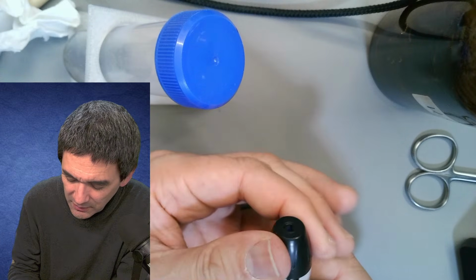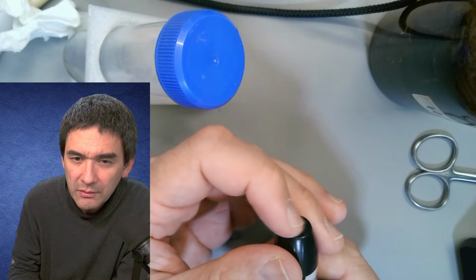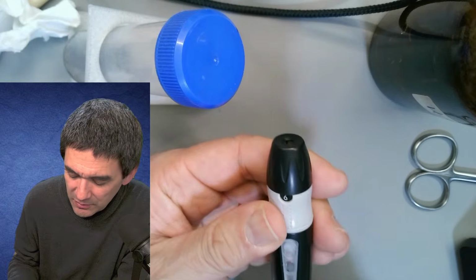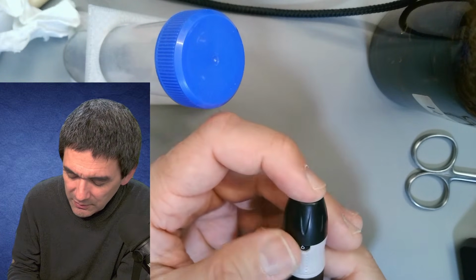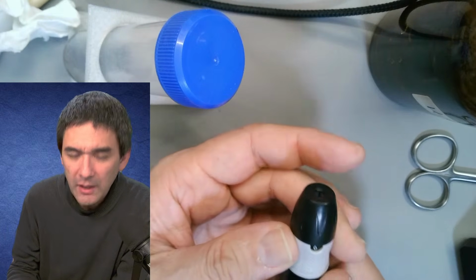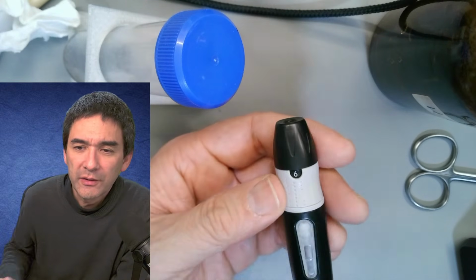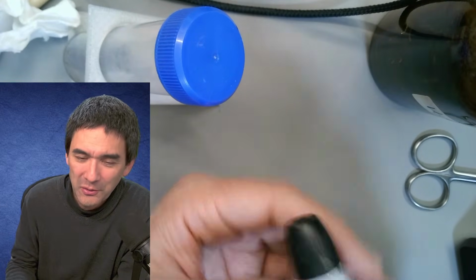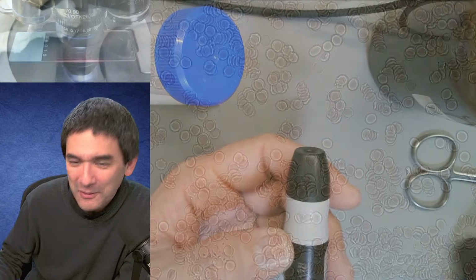But still nothing comes out. I don't know. Maybe the length is not the same. No? Yeah. I don't know. I'll try to get this figured out. But having this in any case makes it much easier, of course, to observe blood under the microscope.